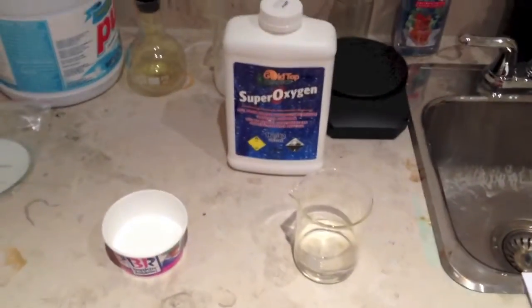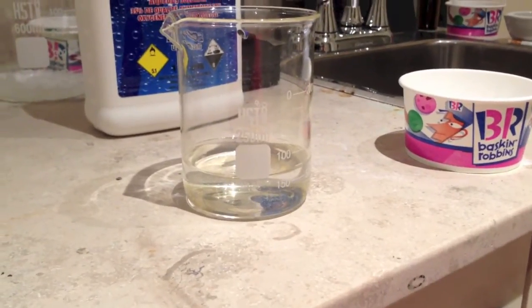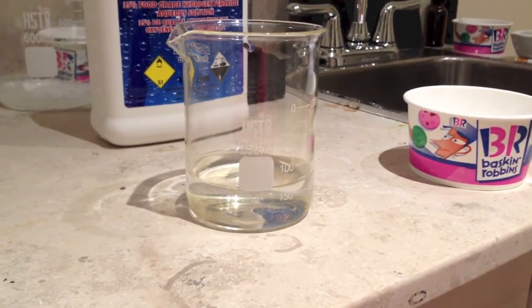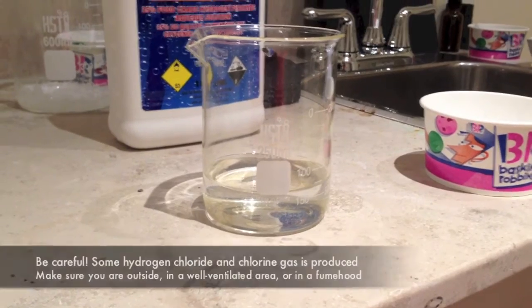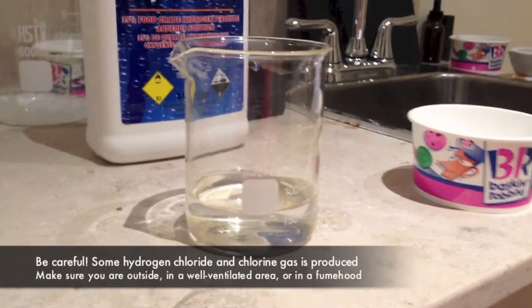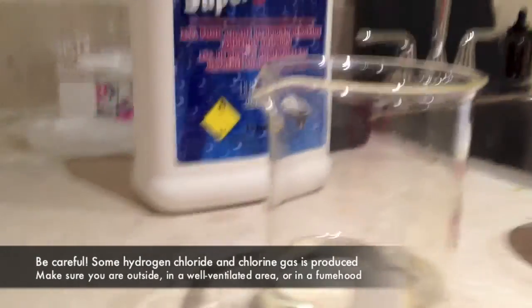So let's get started. I'm now going to turn off the lights and slowly add the sodium dichloroisocyanurate into the hydrogen peroxide. There we go. We should be able to see a red glow form as we add the chemical.